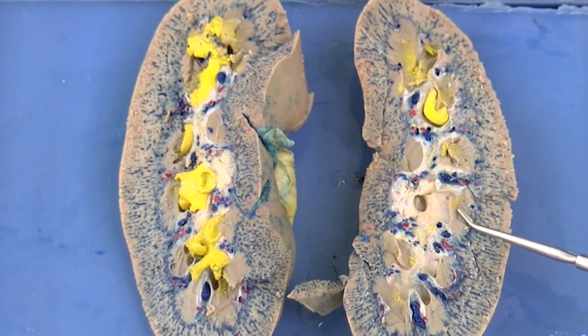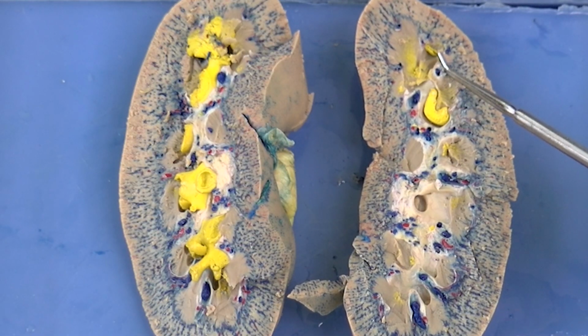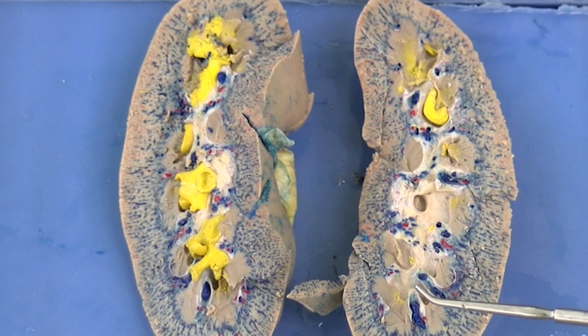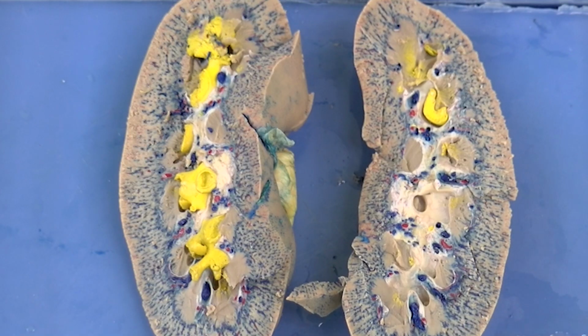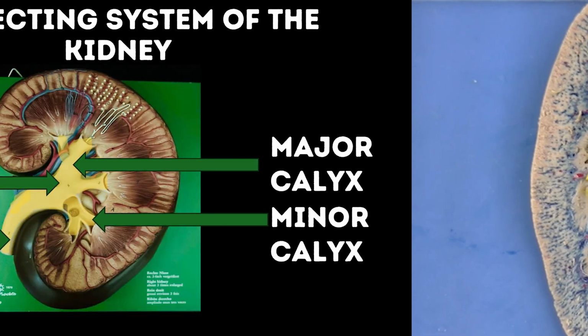These are called the renal pyramids. The renal pyramids, depending on what specimen we look at, there's going to be a different number. So not all of us have the same number of pyramids. But what's unique here is between those pyramids, they're differentiated by what are called renal columns.